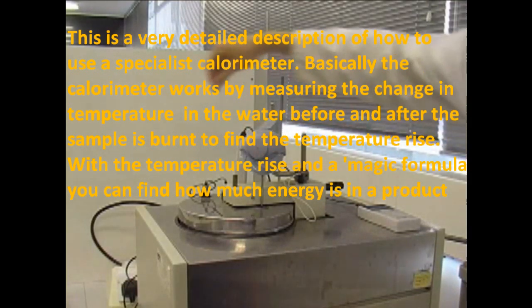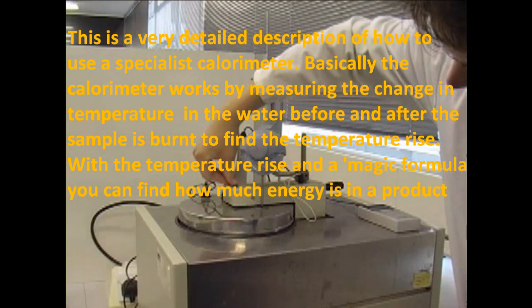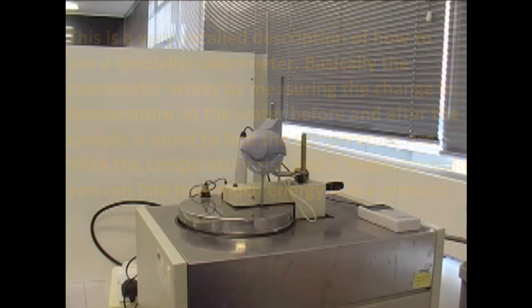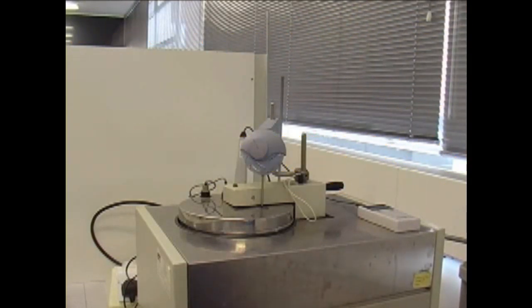Once the ready light on the calorimeter has come on, the apparatus can then be fired by pressing and holding the fire button.